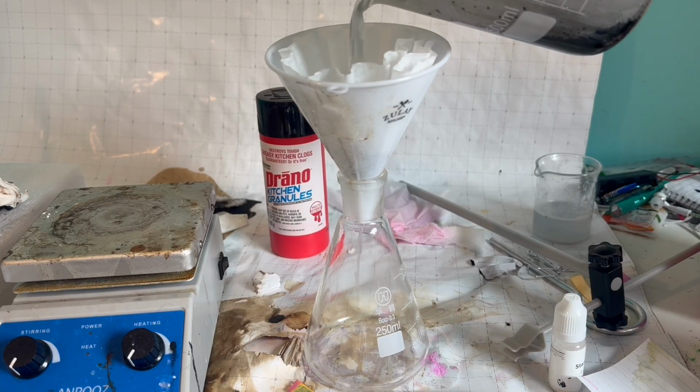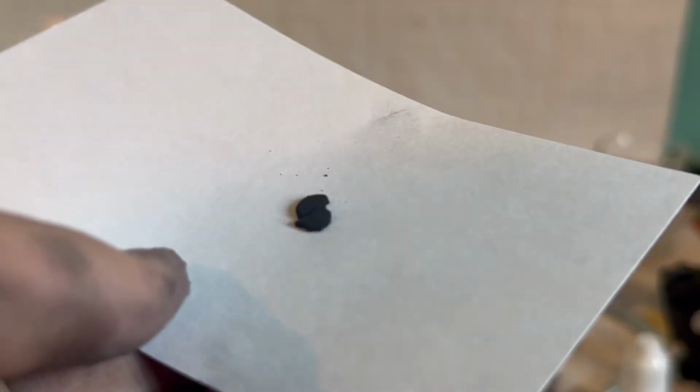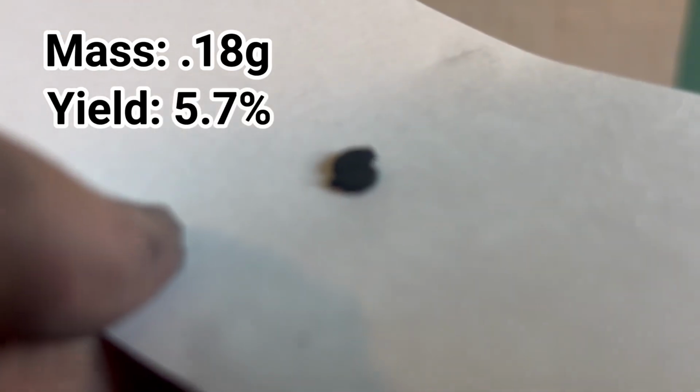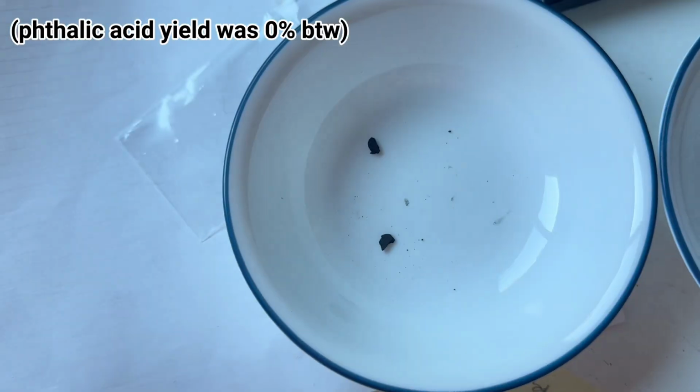I filter everything off, and I'm left with a loose bismuth powder that I compress into a tablet. The tablet weighs 0.18 grams, which represents a yield of 5.7%. Well, at least it's better than my phthalic acid yield in the last video.